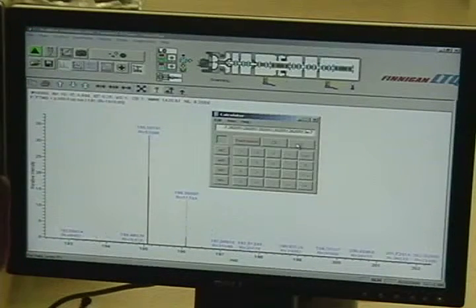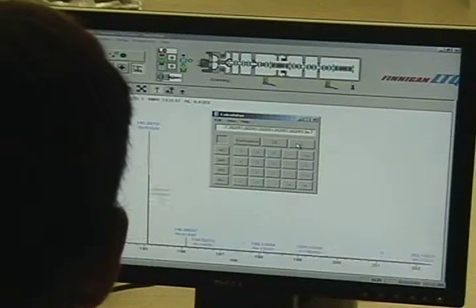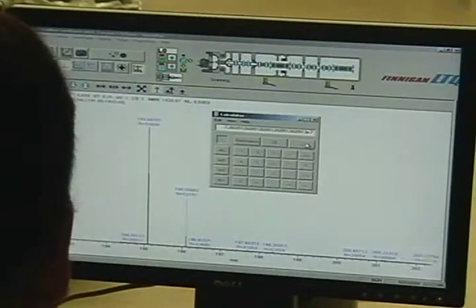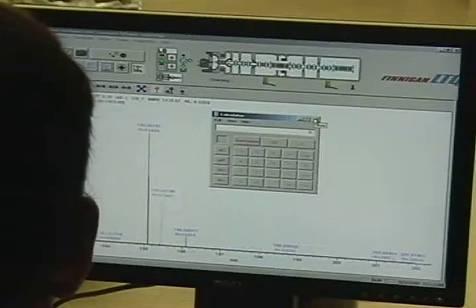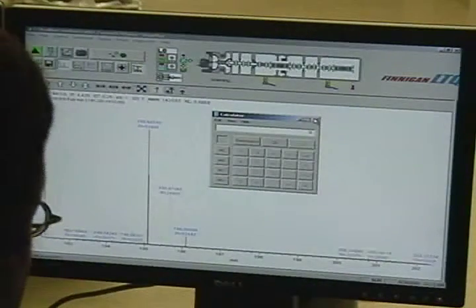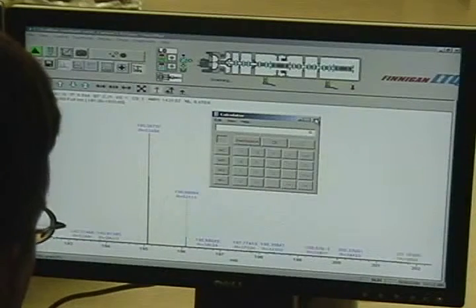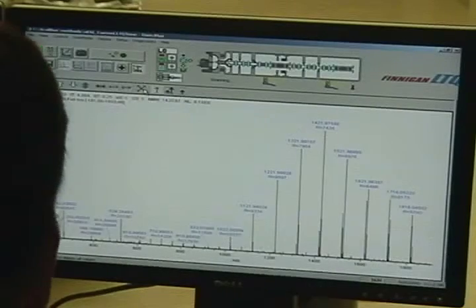0.7. Okay, so with this mass calibration, you're in from 0.7 on the bottom, 0.2 for the MRFA, 1.4 and 1.9 for the Ultramarks, which makes sense. Why does that make sense? Because our mass accuracy is inversely related to mass over charge. So we get our best mass measurements at low. The smaller the m over z, the better the mass measurement. Okay, so you have a good mass cal.